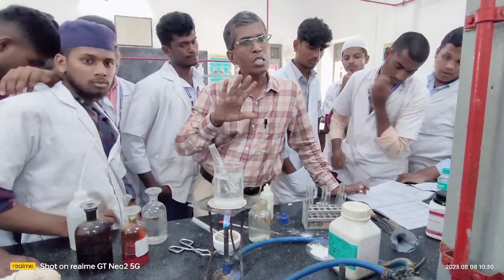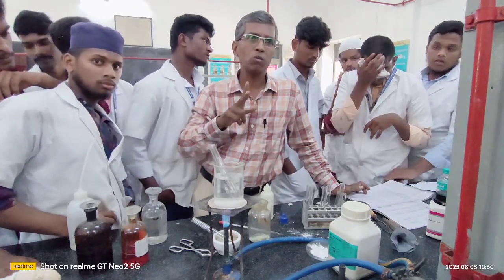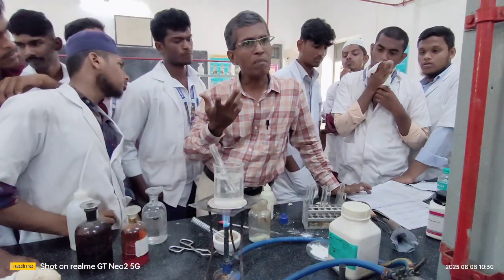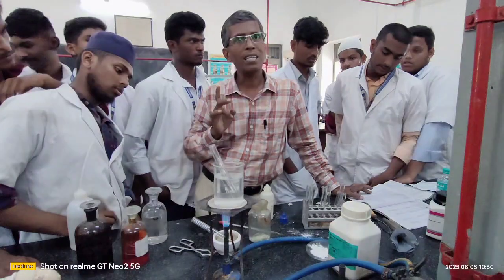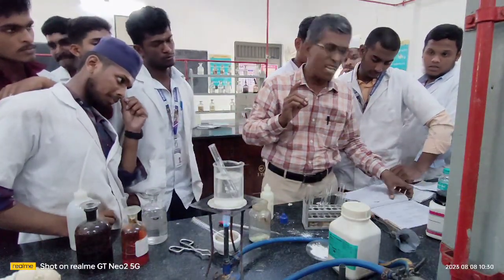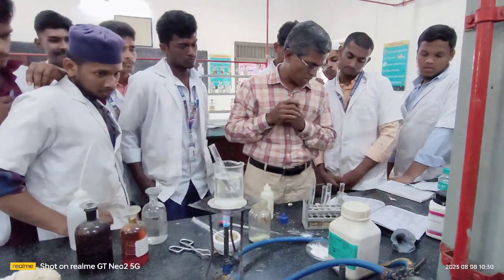Now, since both aldehyde and carbohydrate lead to the formation of silver mirror, you can ask me how to confirm the carbohydrate, how to differentiate carbohydrate from aldehydes. There is a simple test. The test is called Molisch test.